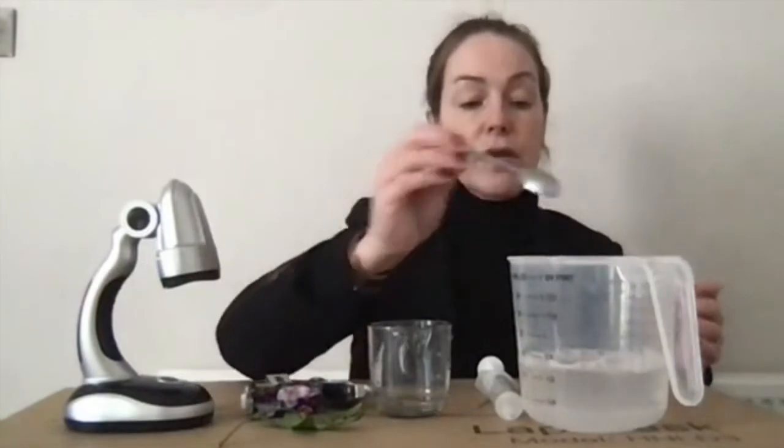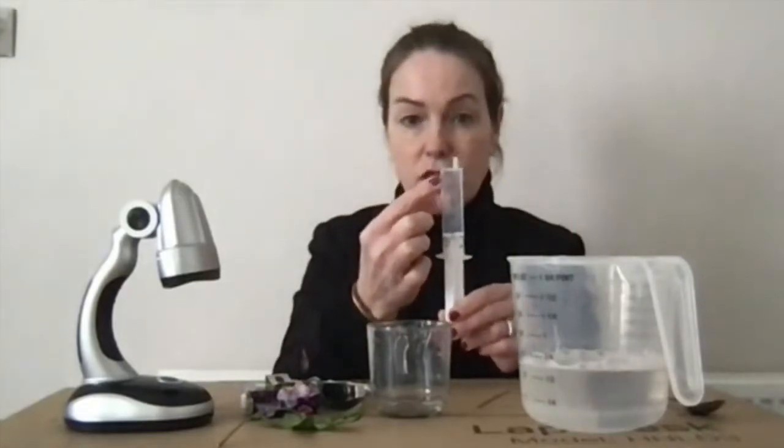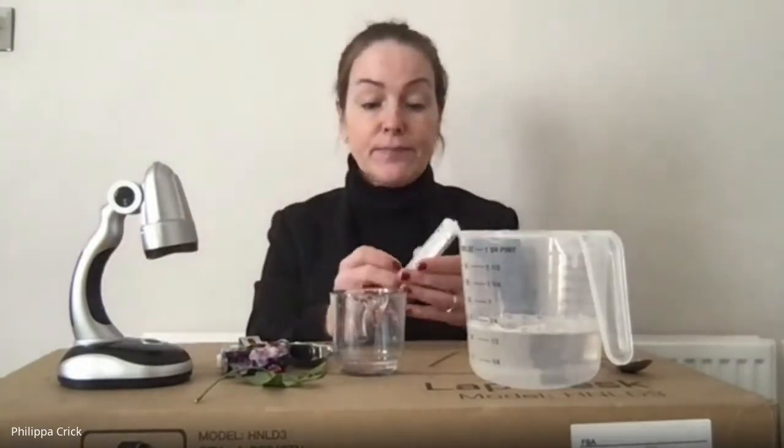So what we're going to do is see how quickly leaf discs can float to the top of this syringe. So we've got to make some leaf discs and then draw all the oxygen that is sitting in the air spaces in the leaf out. And if we can draw the oxygen out of those air spaces, it means that they will sink. As the leaf discs photosynthesize, they release oxygen, which gets trapped underneath the leaf, and it makes the leaf rise. And the quicker the leaf rises, the faster the rate of photosynthesis.